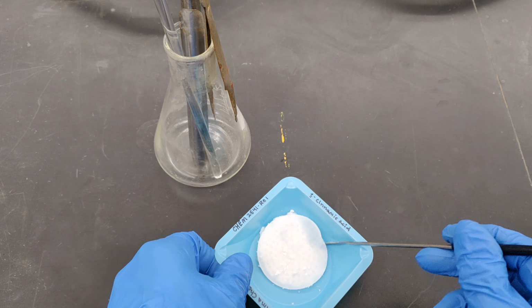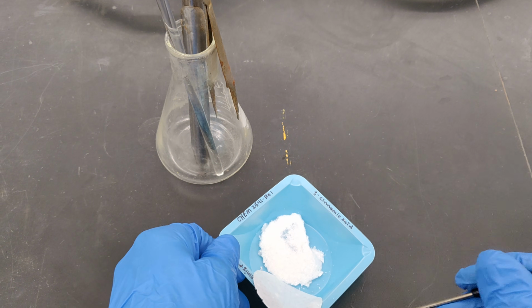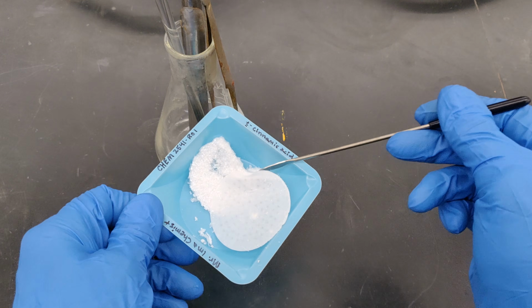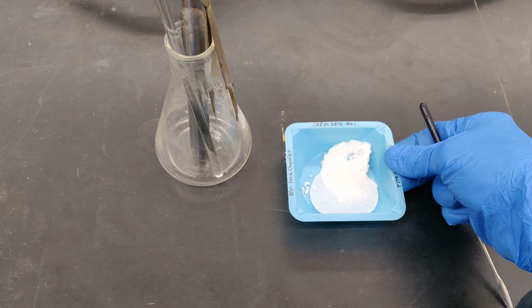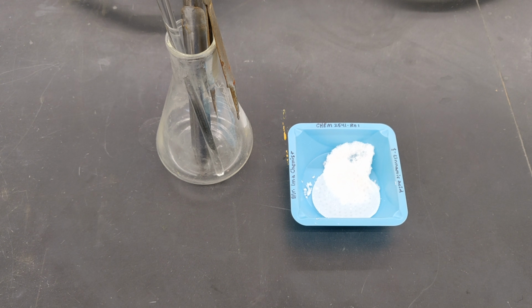Don't worry about any solid that clings to the filter paper and boiling stones. Once the sample is dry, it will easily become dislodged, and at that point you can discard the filter paper and boiling stones. Place the weighing vessel in your lab section's communal storage drawer and allow the solid to fully dry before proceeding.